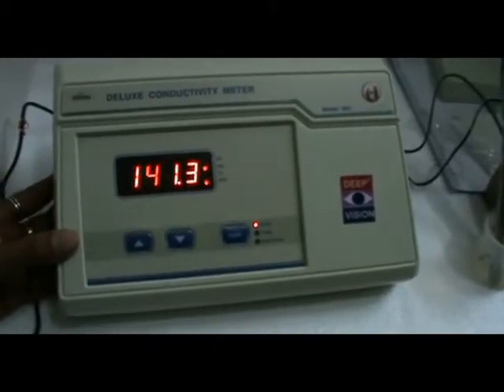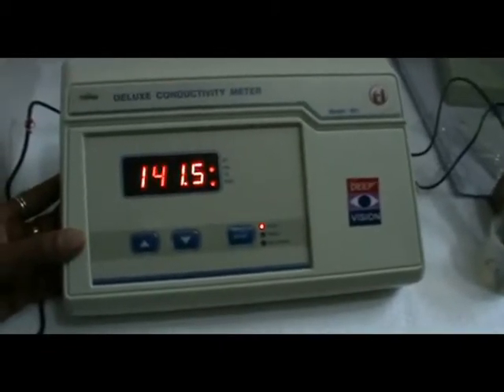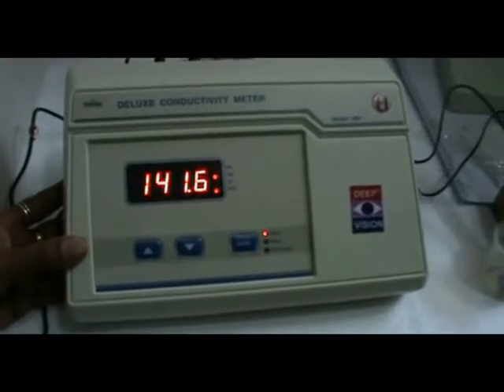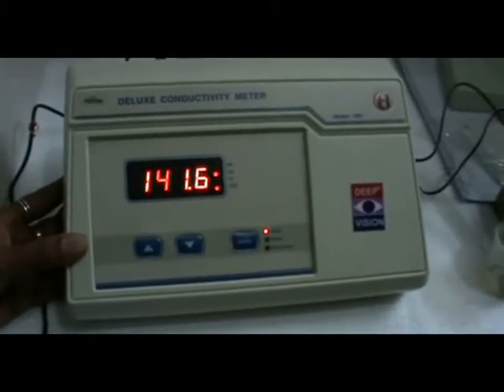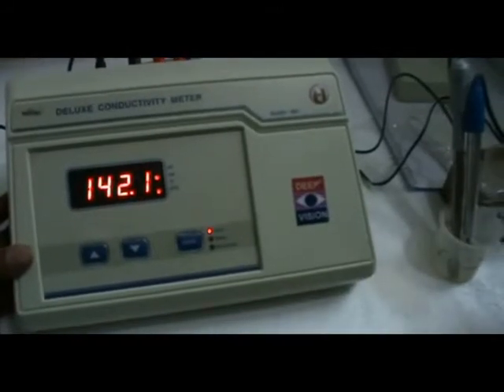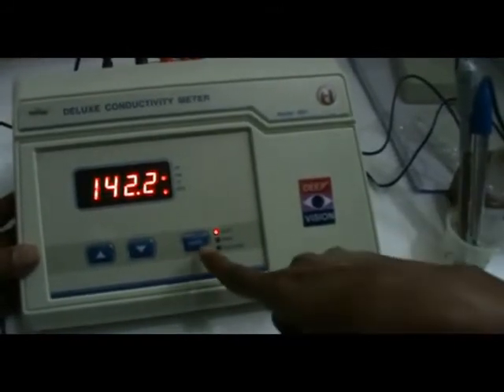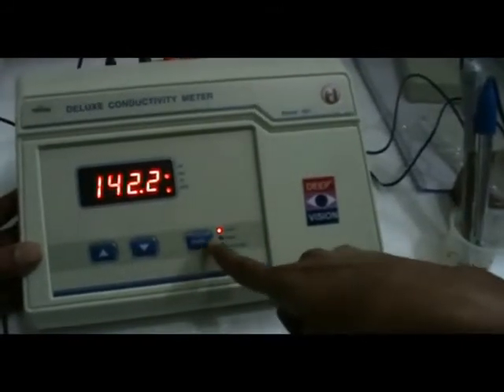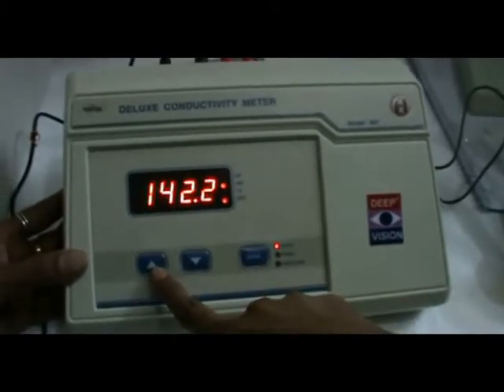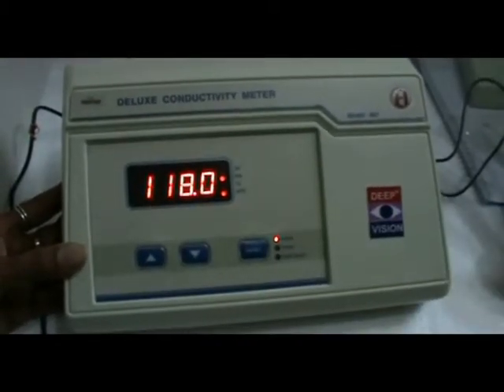Now you can place your sample and take the reading. Use the increase key to set the value as needed.